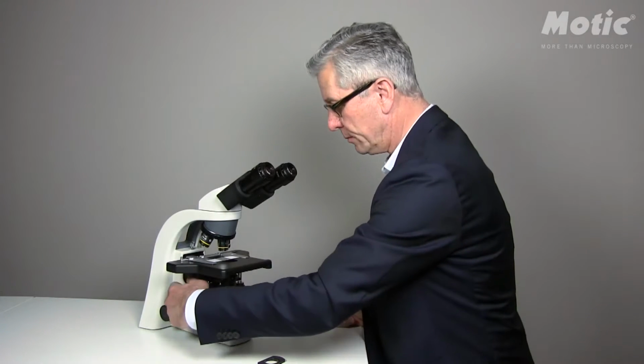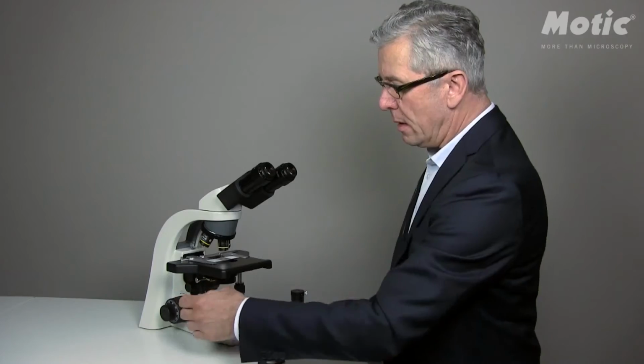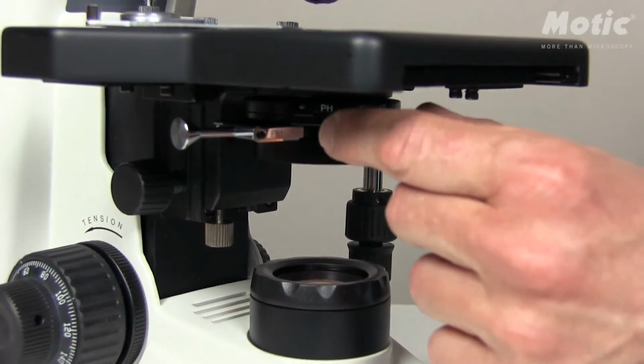Now drive the condenser carrier upwards to the uppermost position. Please note that the slider has got two positions, one bright field position and one phase contrast position. Please go to the bright field position now and do a correct setup for bright field illumination. For BA310, BA310 Elite and the respective BA410 model, this means that you have to use the field diaphragm and do the proper adjustment. In order to finish the adjustment of the illumination, please first open the aperture diaphragm completely.